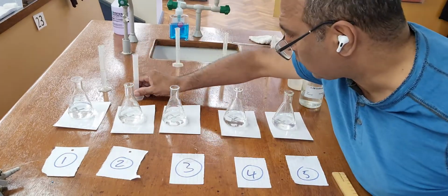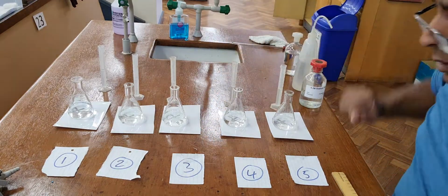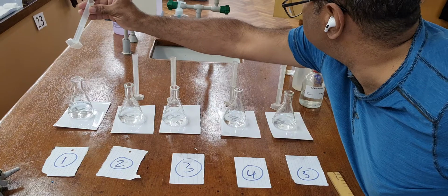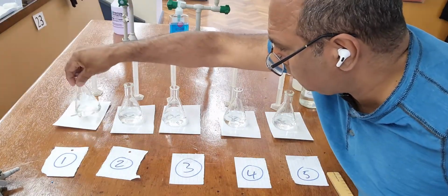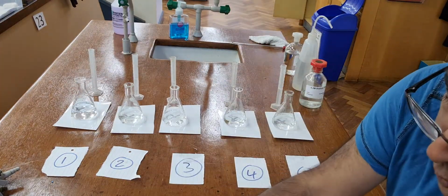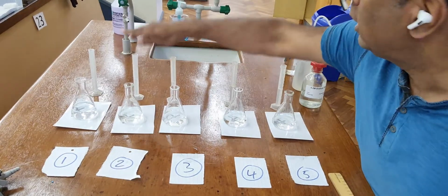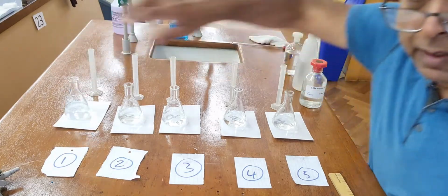And then I've got 5 of acid in these small measuring cylinders, and I'm going to add the first one. There's a clock's coming up there now, and give it a little swirl. And that clock read 11:28. So 30 seconds later, I'm going to do this one. And 30 seconds later, I'm going to do this one, this one, this one. Now this one, can you see it going cloudy?